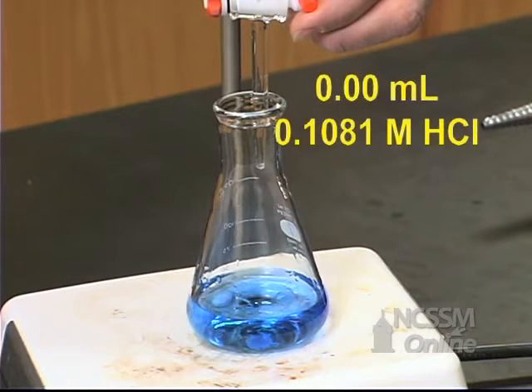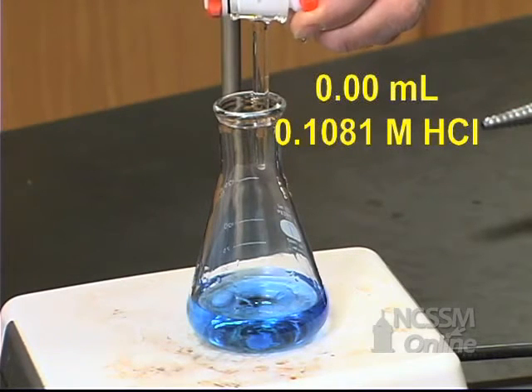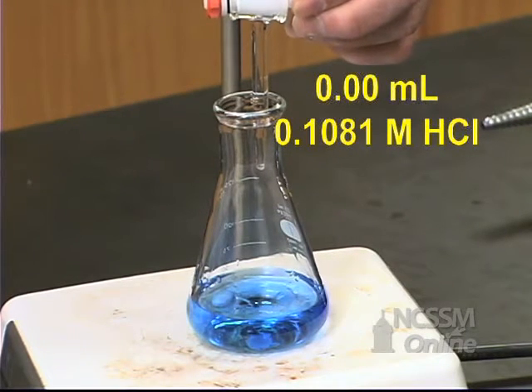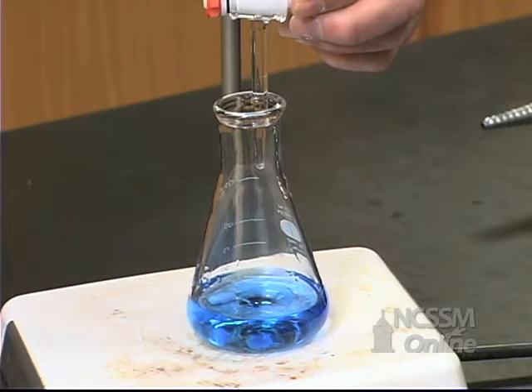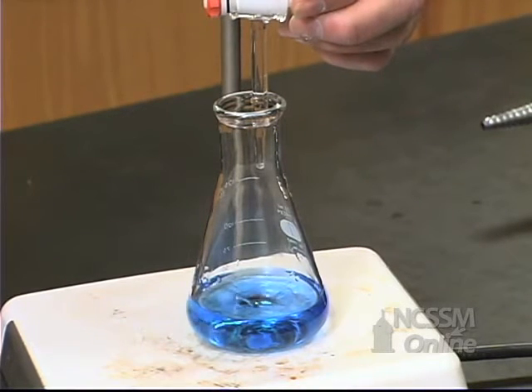We've taken an initial burette reading. We'll slowly add the HCl until the solution turns a pale yellow color.